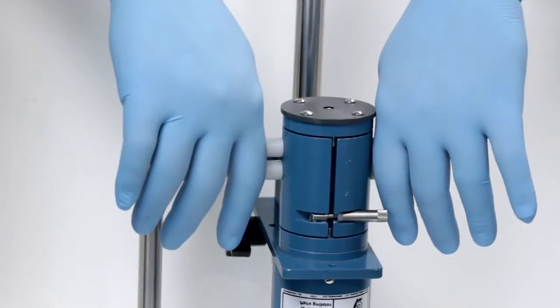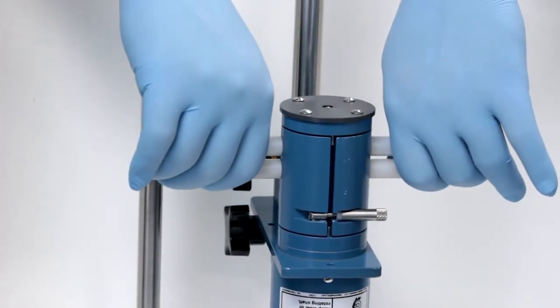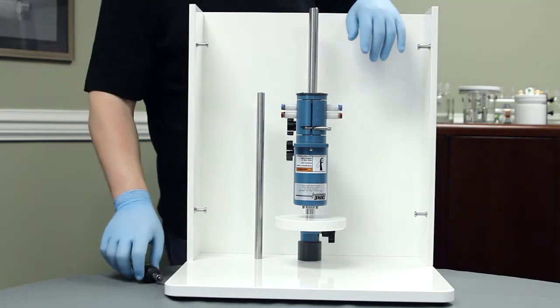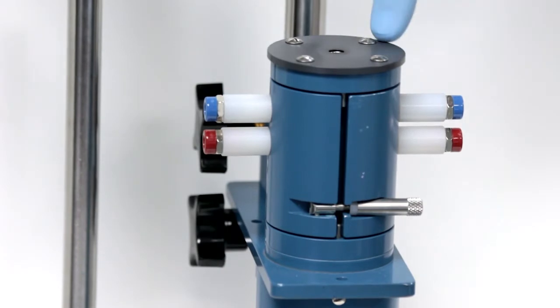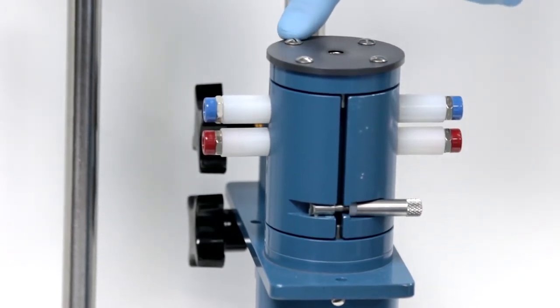Now that the motor is inverted and a little bit easier to access the lower bearing assembly, use a flathead screwdriver to loosen the four screws on the bottom of the bearing assembly.